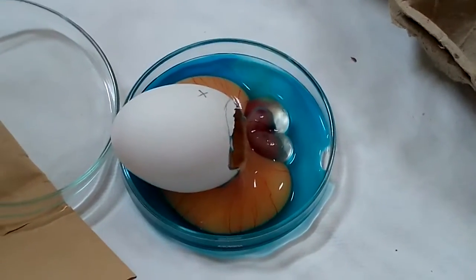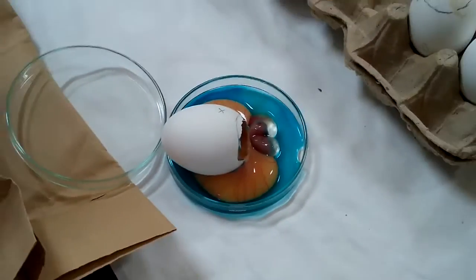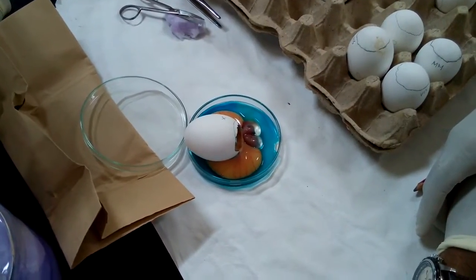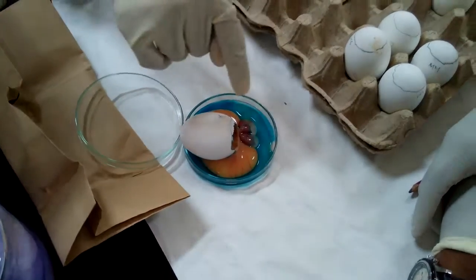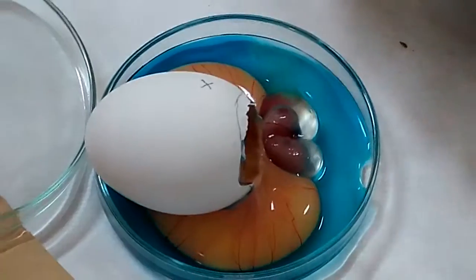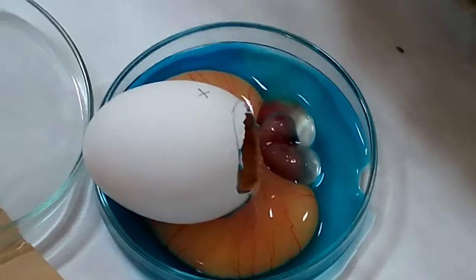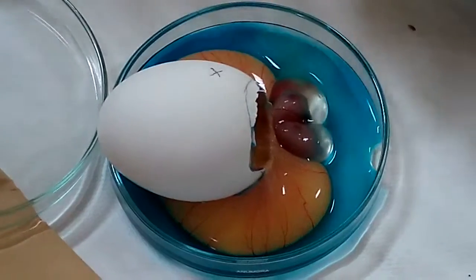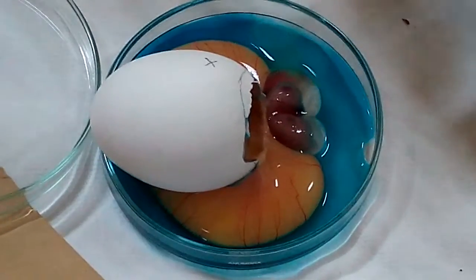Whatever cavity you choose, you may get virus from all cavities, because virus doesn't multiply in the fluids — it multiplies in all the membranes and is disseminated into those fluids.